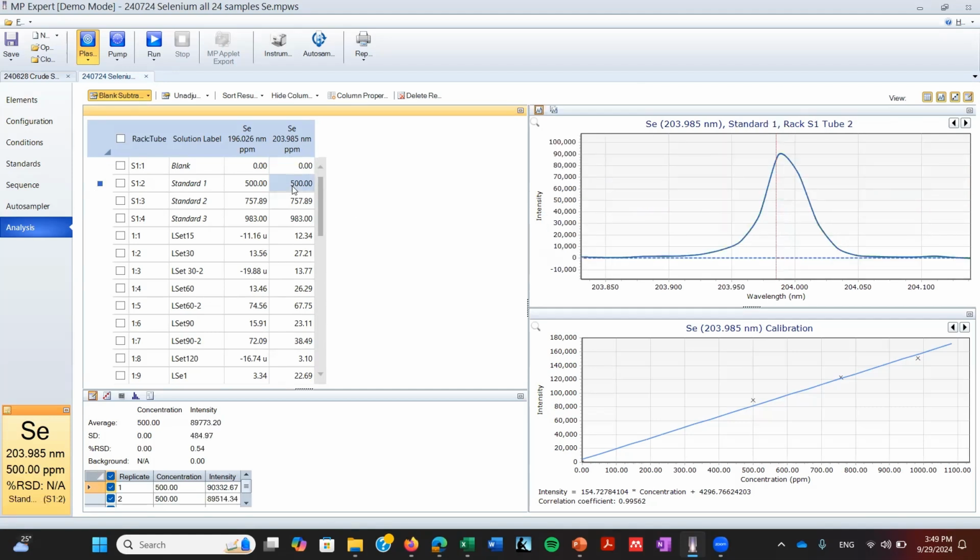But then when you go to the standard one, you can see 90,000 intensity signal. And this one is also very high. This one is very high. And they are proportional to concentration. So we can say that they are valid data just looking at this.